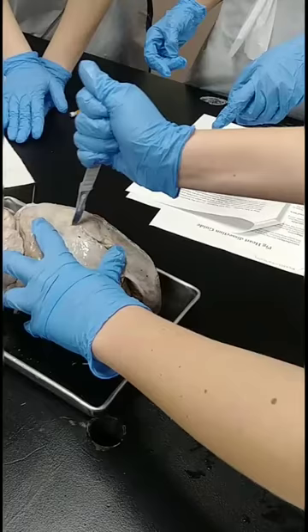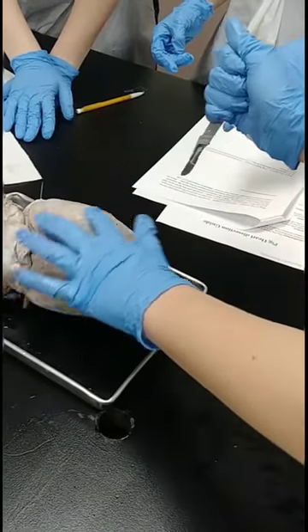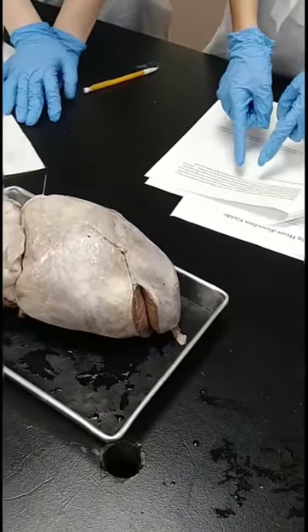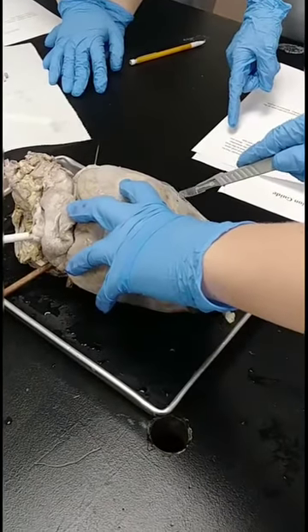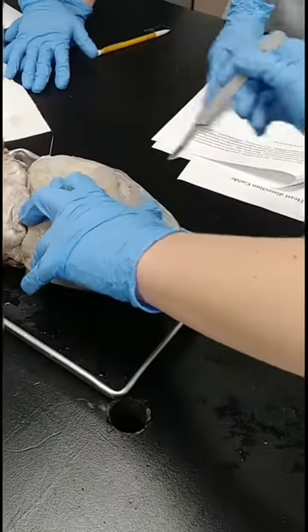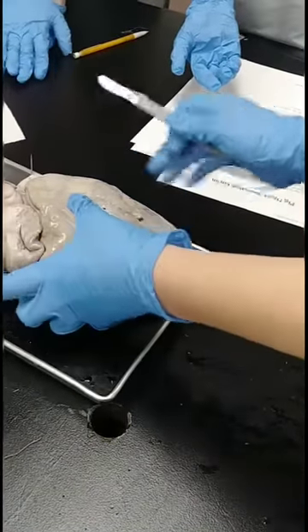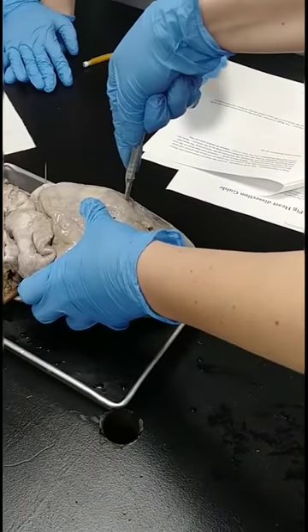You can see the pericardium on top. Look at the page in the guide. When that is open, carefully pin it down to the wax. You need to cut the groove — the one that we found earlier. Cut it out and cut it open.